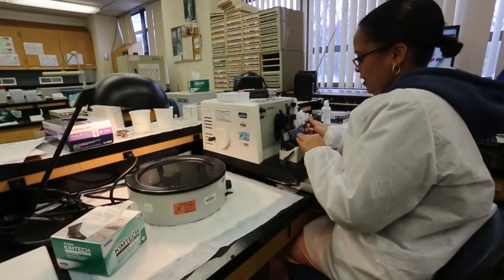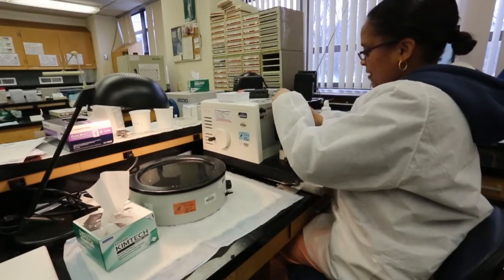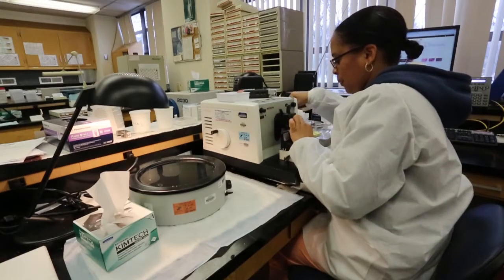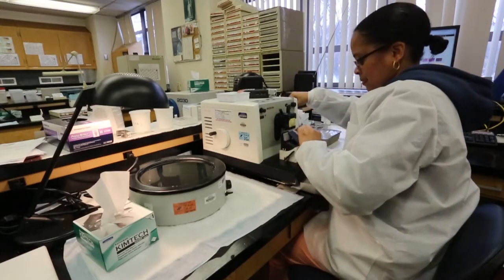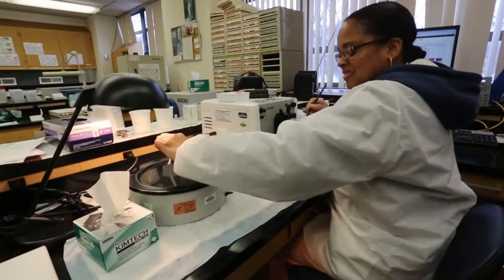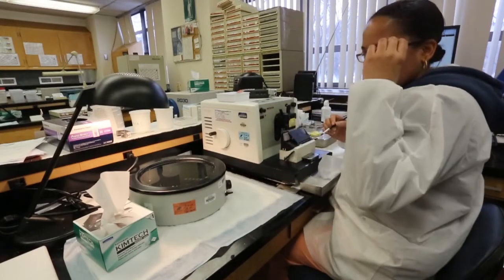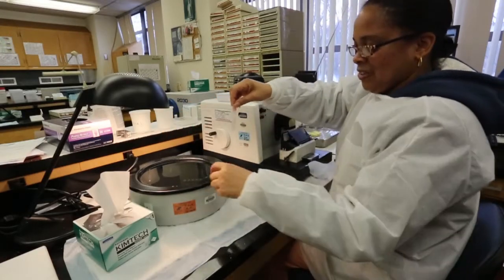I'm going to move this down and start a fresh cut on the first block. Each turn is five microns. Can you see this? This is my ribbon. And you would sort of attach it to the side so it won't start floating all around — you don't just randomly throw it into the middle or you wouldn't be able to pick anything up. So it attaches to the side — if you do that otherwise you'll be chasing it.